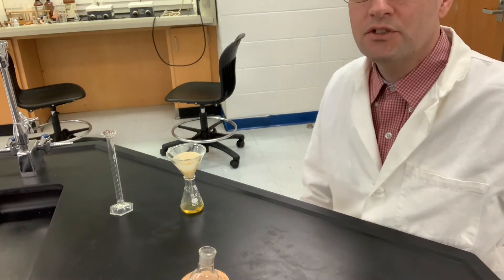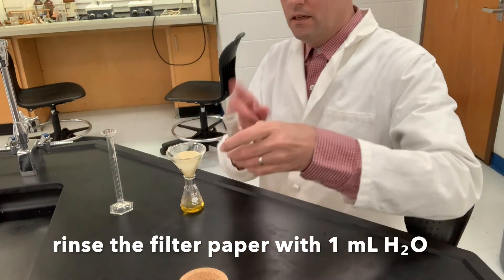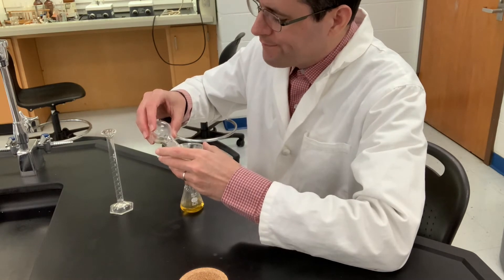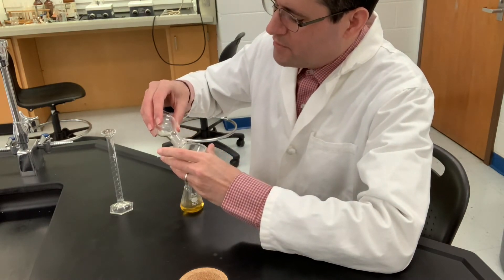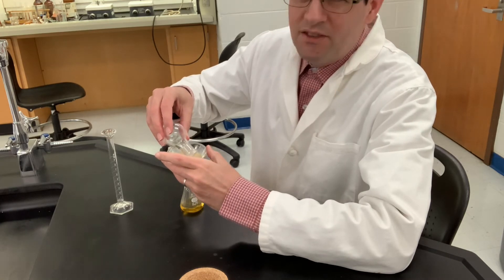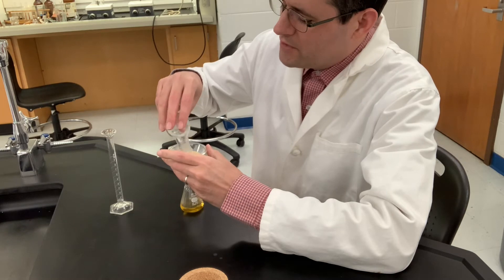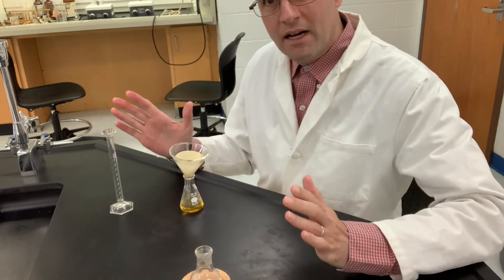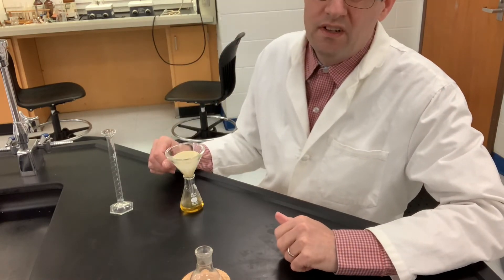We're back to add our one milliliter of DI water to wash the contents. It wouldn't hurt if we used five milliliters but it's so slow for this liquid to pass through the filter paper, so we just do a very small amount. I'll come back in about five minutes and we'll proceed onwards from there.